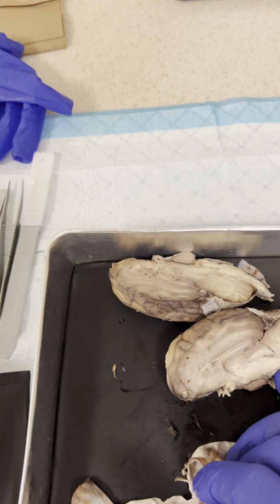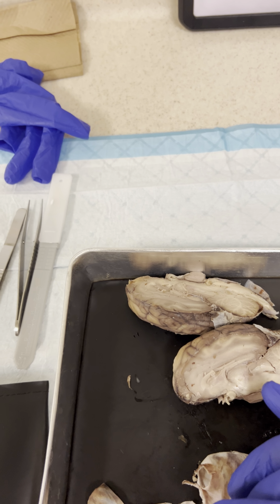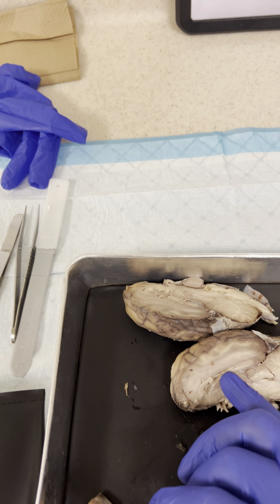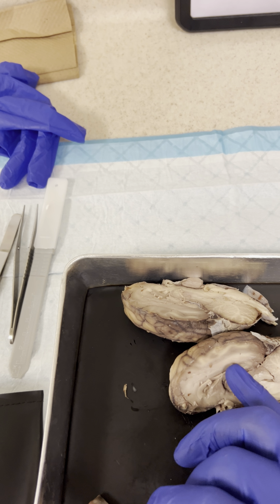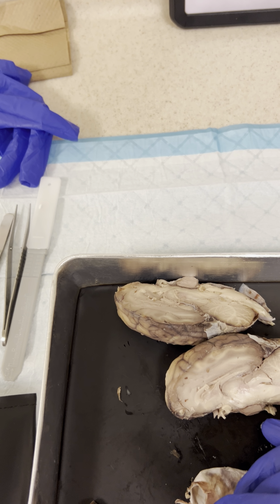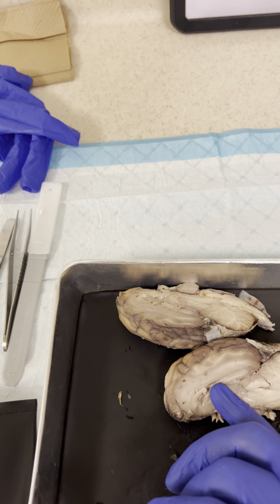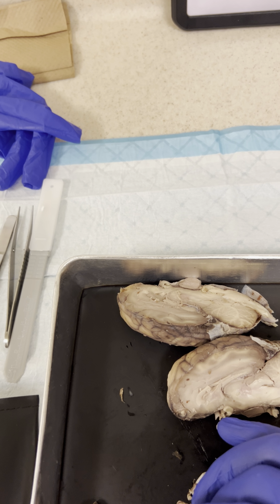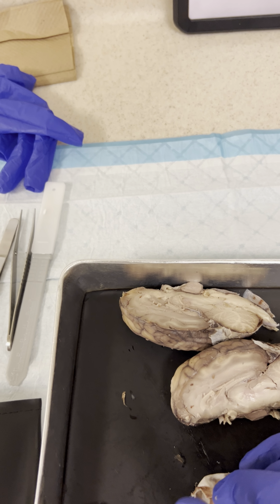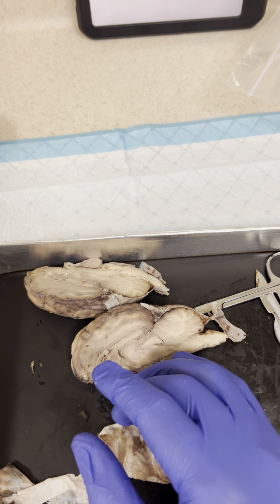The septum pellucidum is in this area, and the choroid plexus of the third ventricle starts up here and then goes down in there. This is also the third ventricle. Cerebral aqueduct leading into the fourth ventricle. All right, and that about wraps it up.